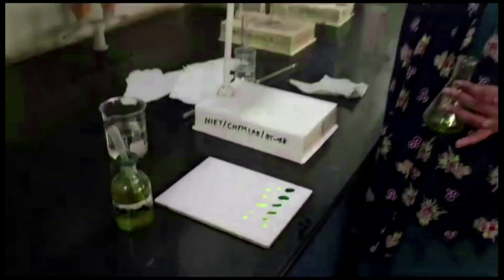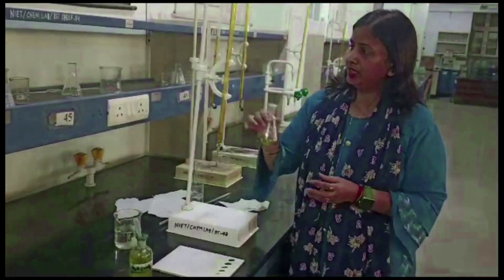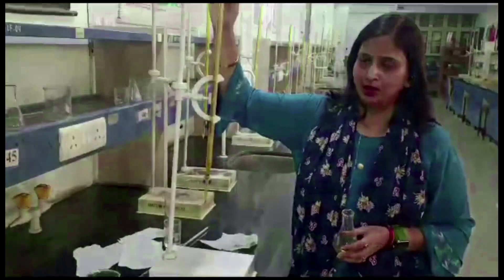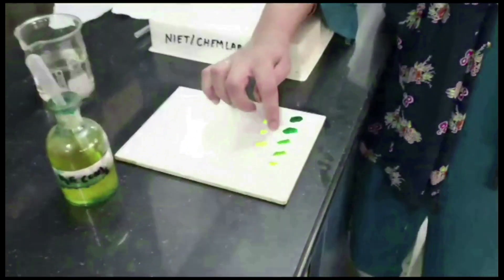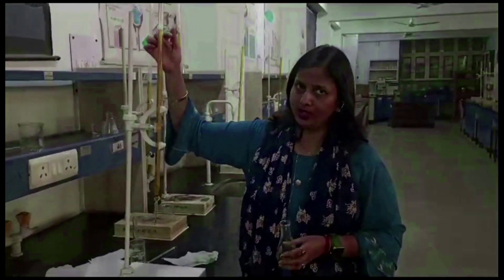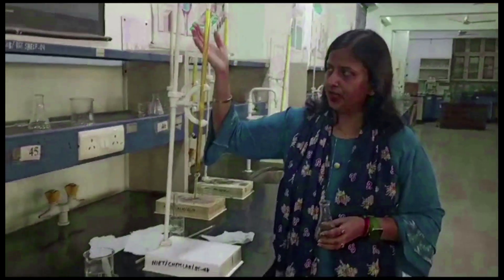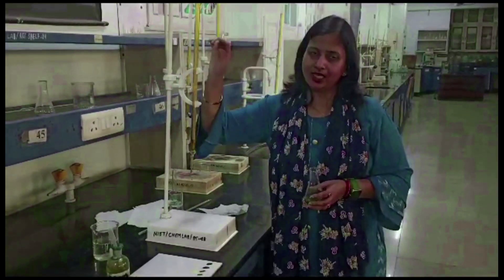In this first reading we cannot determine the exact end point — it only gives an idea of the end point. In the second reading we will get the exact end point. Since we know the end point is beyond 4 mL, we directly add 4 mL solution and then check at 4.1, 4.2, 4.3, 4.4, 4.5, 4.6, 4.7, 4.8, 4.9, and 5.0 mL. The reading will be between them, giving the exact end point.